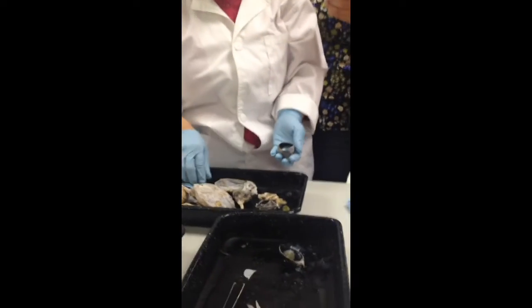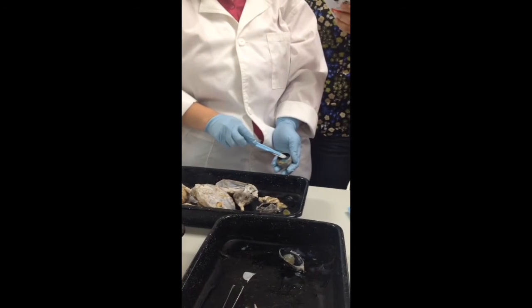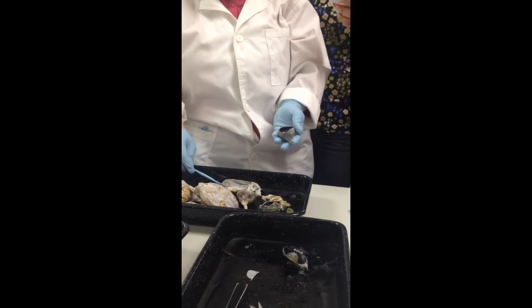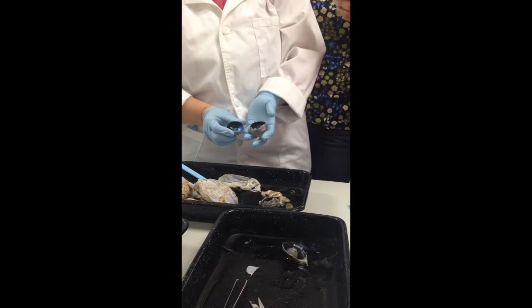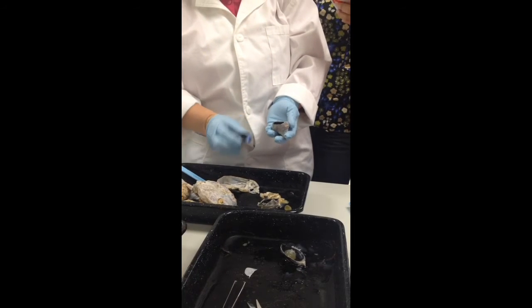Okay? All right, below the retina, in animals that have night vision, you have this shiny layer here. That is called the tapetum. And the tapetum has reflective particles, like you see here, reflective pigments. And that's what allows you to see that shine in the cats when you shine the light at them at night. Okay, so anything that's got night vision is doing that.